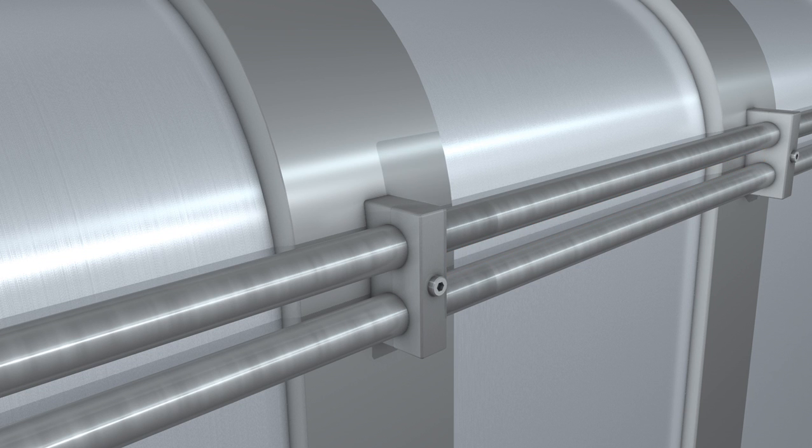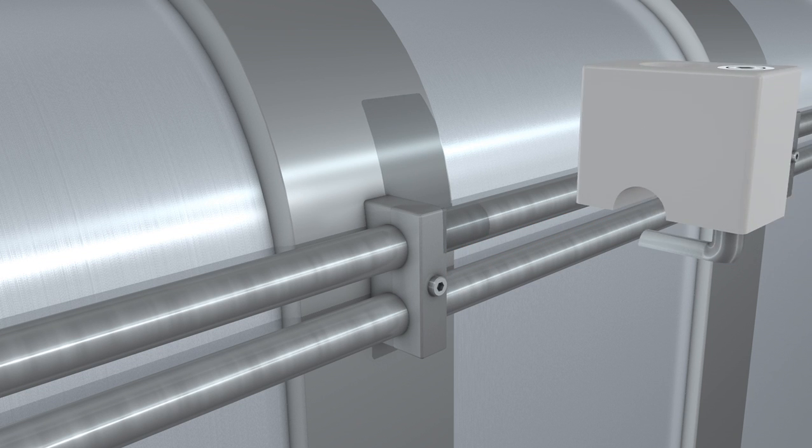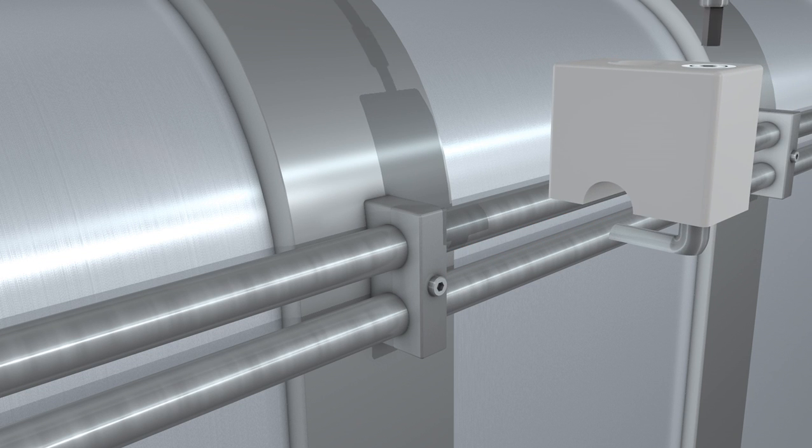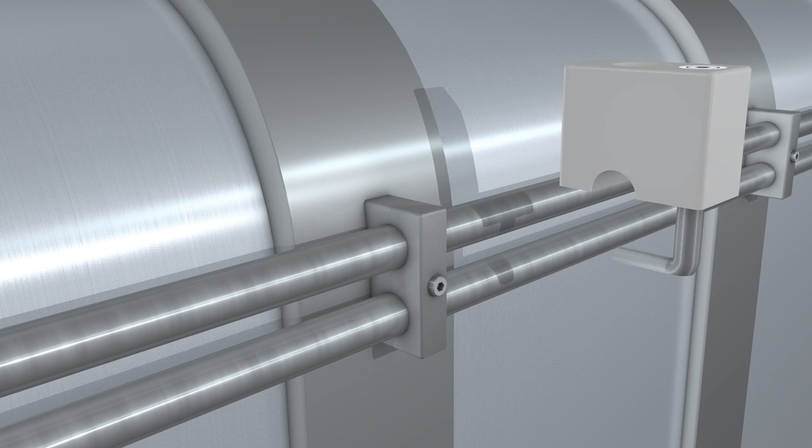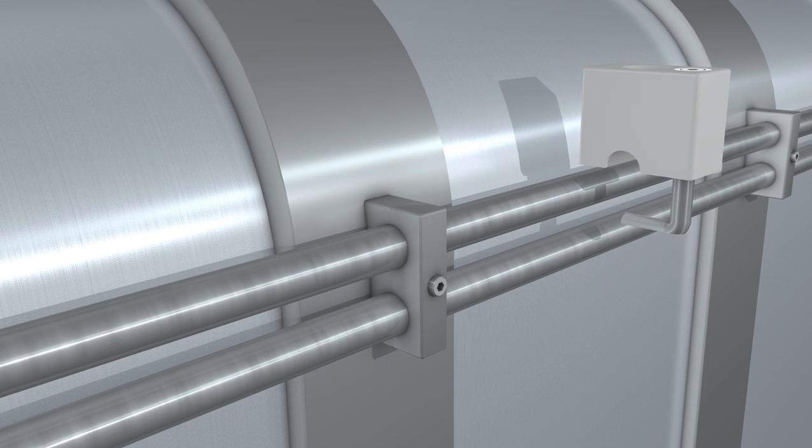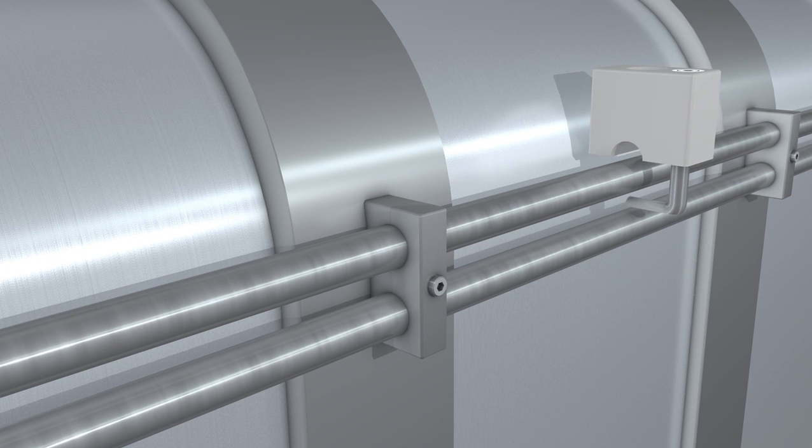In this case, the bottom part of the clamp block is replaced by a bracket. The bracket is loosened to allow the block to be fitted to the pipe. The screw is then retightened and the sensor is reattached to the block.